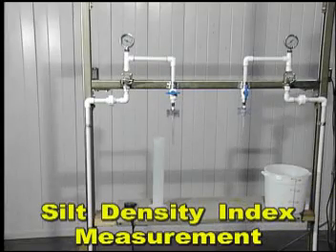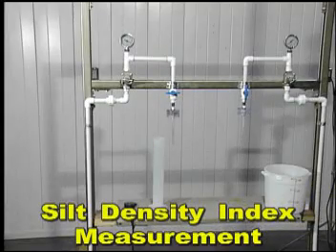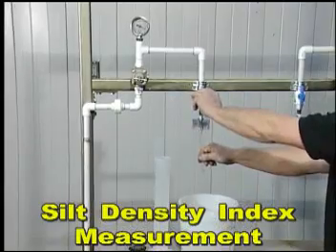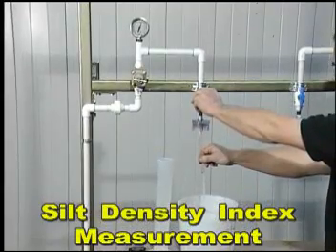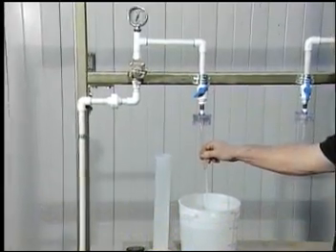The following is a brief description of the SDI test procedure. The sample line is thoroughly flushed out prior to running the test.